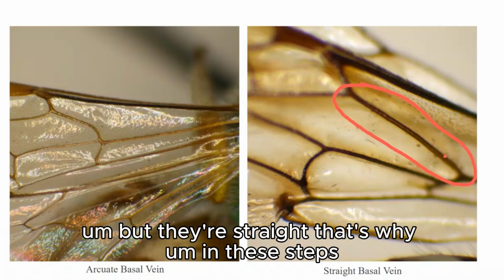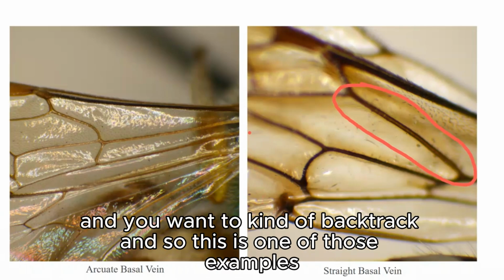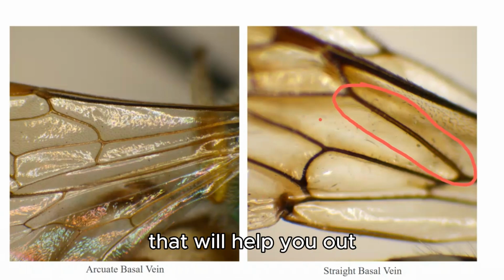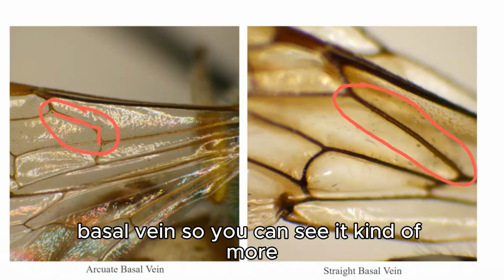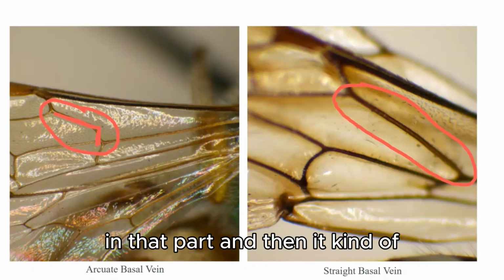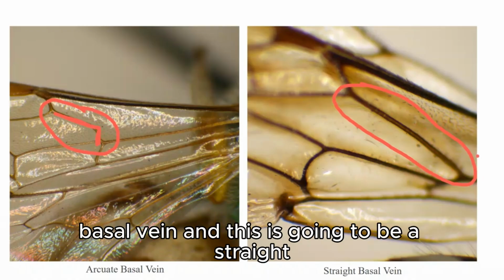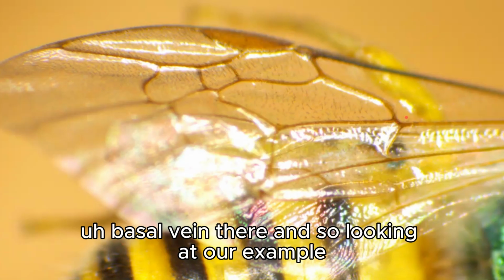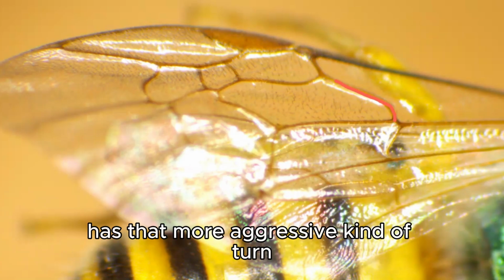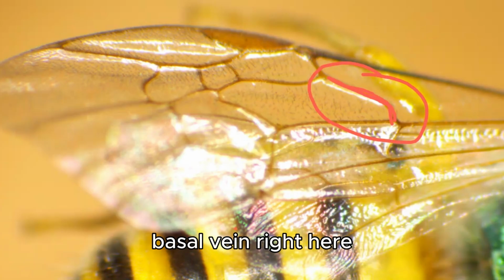That's why in these steps you will be following along in your notebook, and this is a couplet that you can star in your book, and you want to kind of backtrack. And so this is one of those examples that will help you out. So this is an example of a straight basal vein, and then this is going to be an example of the arced basal vein. So you can see it's kind of more vertical right in that part, and then it kind of shoots more that way to the left. And so this is going to be an arced basal vein, and this is going to be a straight basal vein there. And so looking at our example, you can see that it kind of has that more aggressive kind of turn. And so this is going to be an arced basal vein right here.